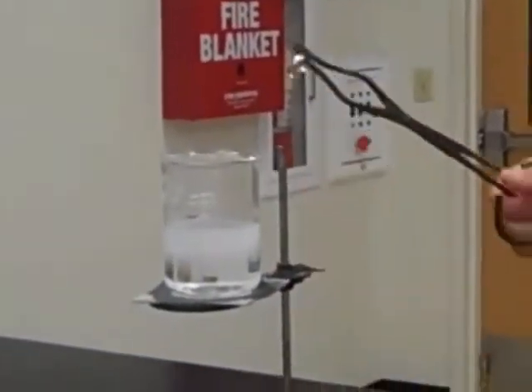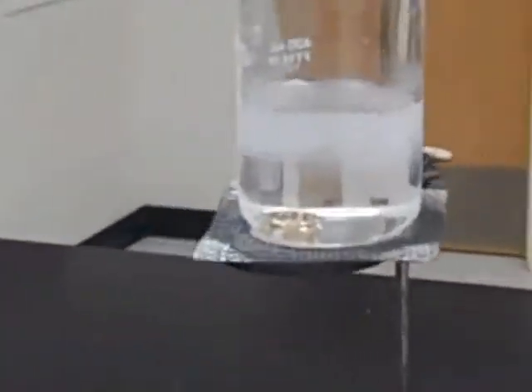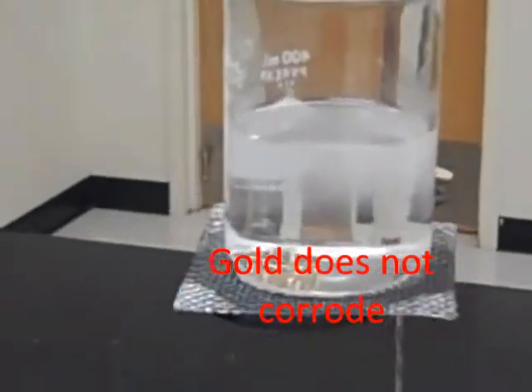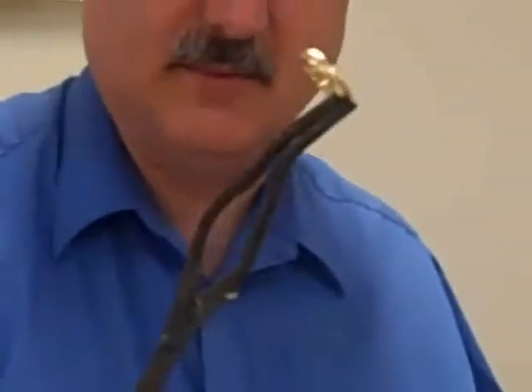There are some exceptions. One big exception is gold, and we can demonstrate that with this gold ring. If you'll take this ring and put it in the same hydrochloric acid, we'll see if it does anything. Just drop it in there. You can see, no fizzing, not doing anything. Let's take it out and see if it's done anything to it. And you see, it's not affected by acid. So not all metals are corroded, but most are affected in some way.